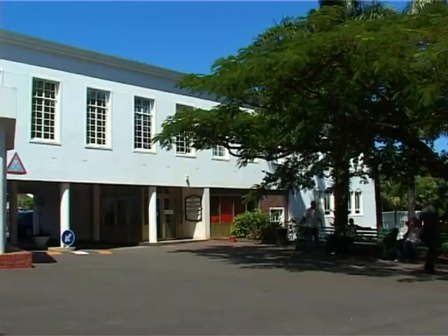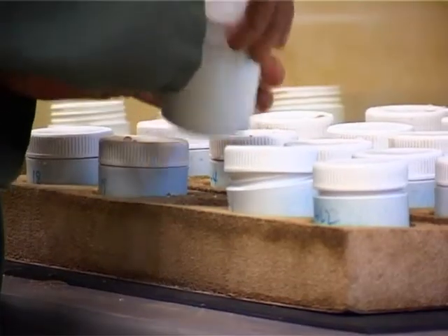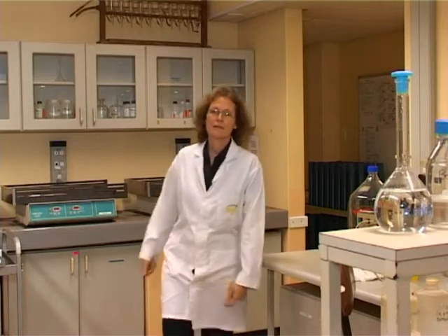Remember that besides routine soil and leaf analysis, FAS also analyses fertilisers, irrigation water, and soil salinity and sodicity. We trust this video has given you some insight into the working of the Fertiliser Advisory Service Laboratory and shown you some of the changes we've made to improve our quality managed system. We believe that these changes will result in a more efficient service for you at FAS.